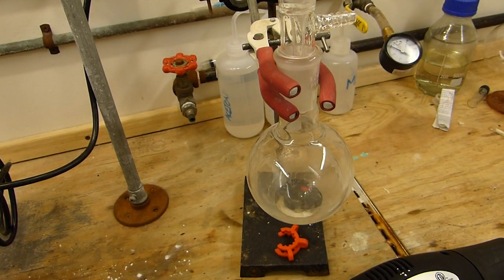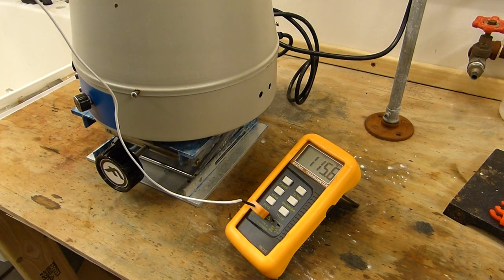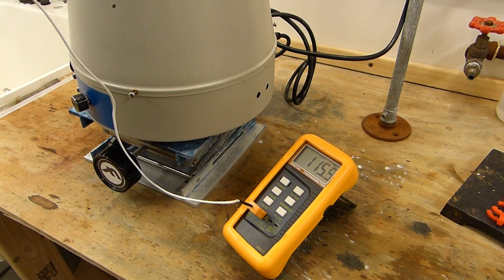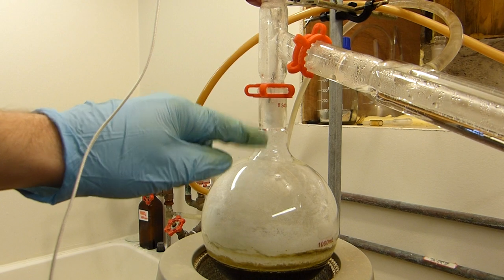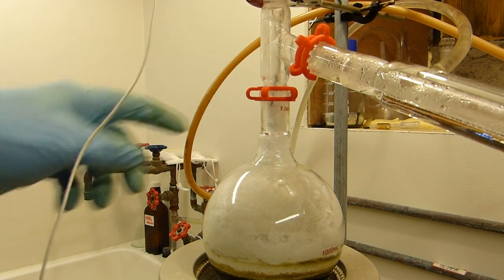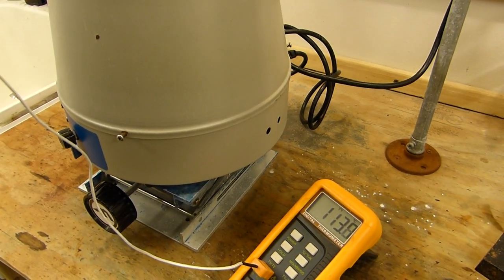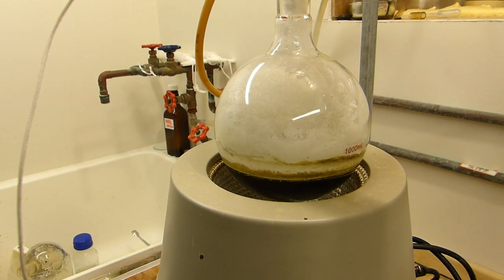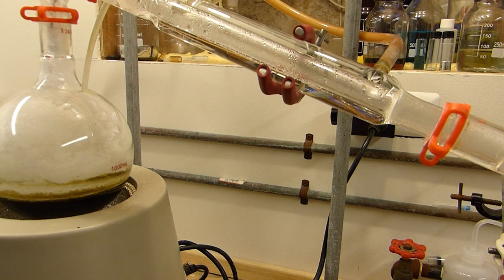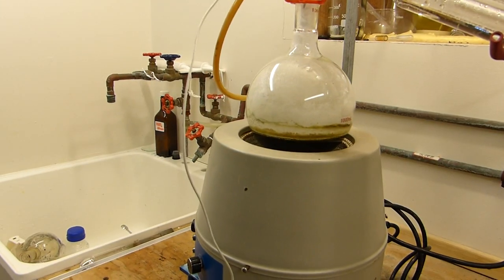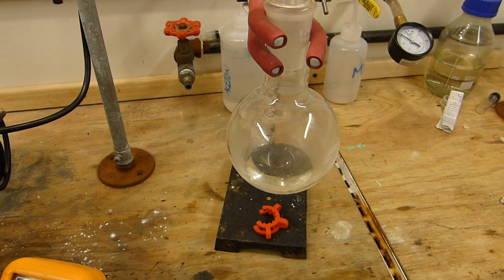All right I lowered the mantle a little bit because the still head temp started to get a little hot. I exceeded by a bit, ended up at about 118 celsius which isn't too bad, but you can see a whole bunch of the nicotinic acid started condensing higher and higher up on the flask and I was risking getting it over in the still head. So this requires some care. We're on the way back down now which is a good sign and I'm just going to raise the mantle back up and turn down the power setting on the heat control over there and hopefully we can find a stable value. Still collecting pyridine at a fair rate though, got about maybe 25 milliliters there.